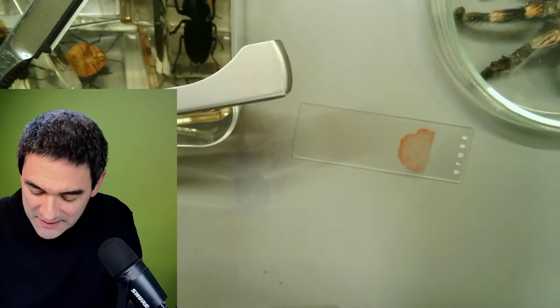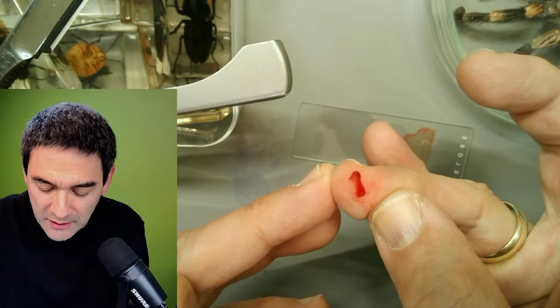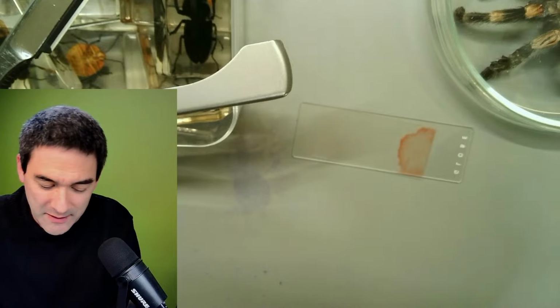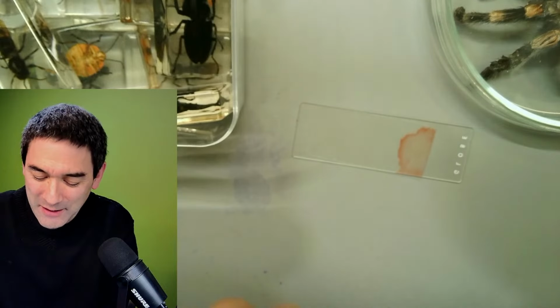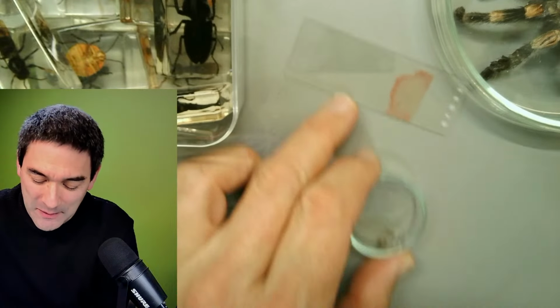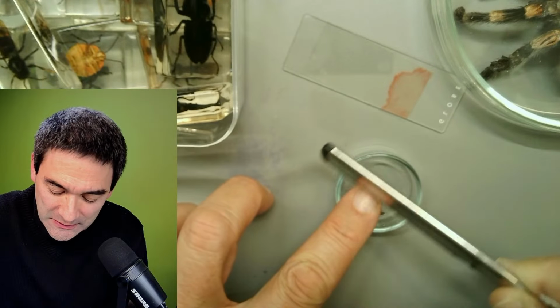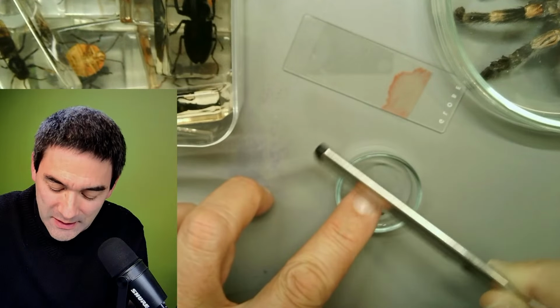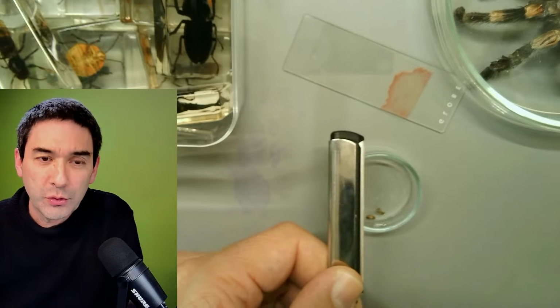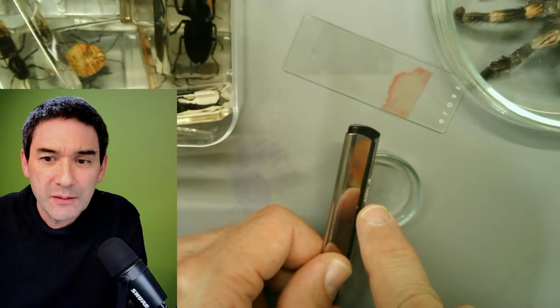But actually, let's stay on topic. Actually, it's a pretty deep cut, I just realized. Ooh, okay. I need to... somehow. What I've done is the following. I'm just gonna show you. That's why you always gotta be a little careful. To feed it some fingernails, all you do is you scratch. This is a sharp razor blade, which I bought for microtoming. And if you do that, you're actually going to see that there is a little bit of fingernail over here.